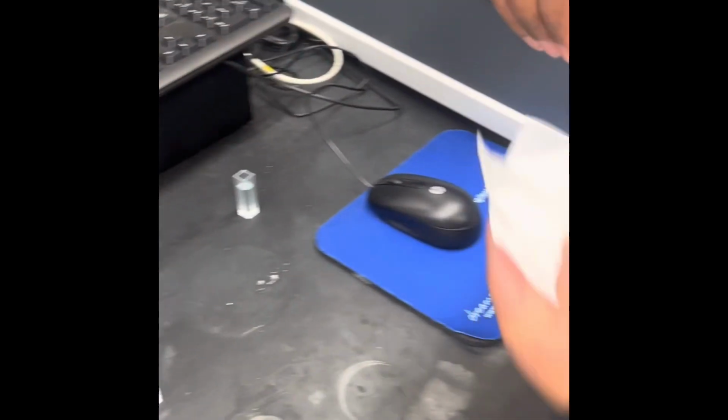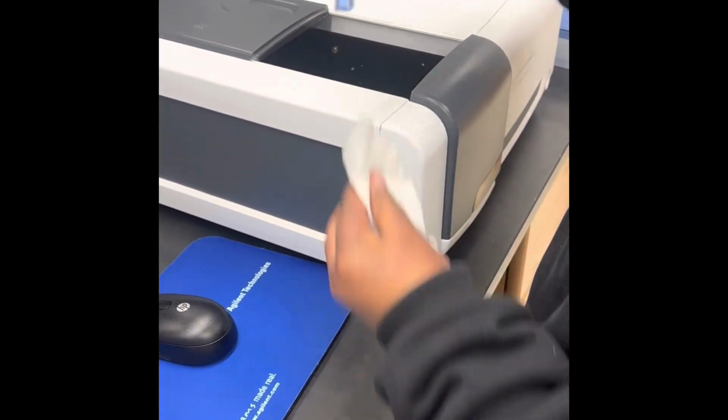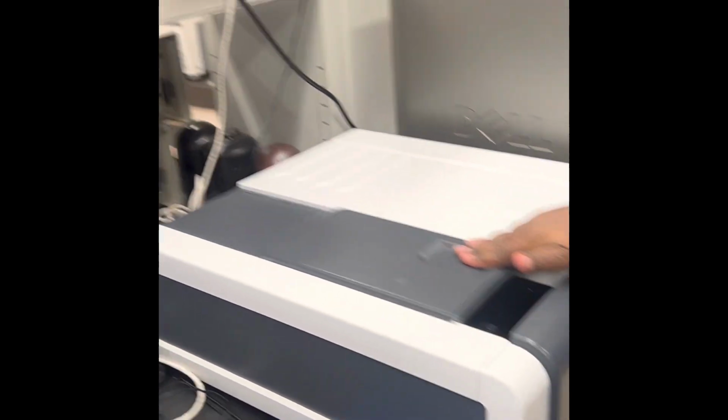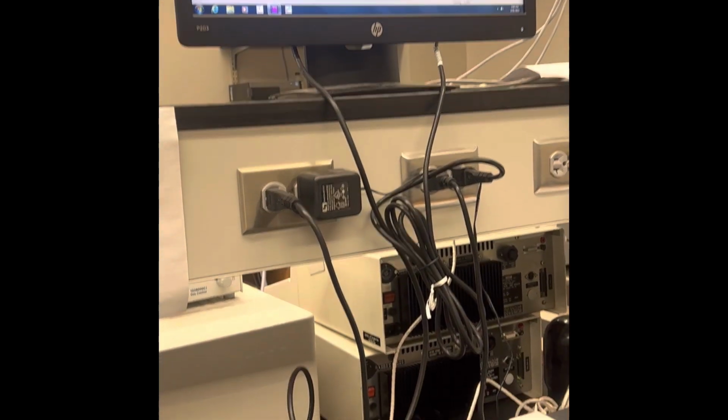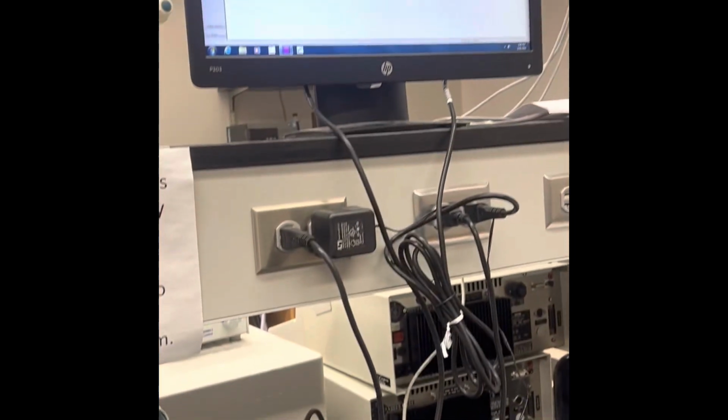As you can see, we're just continuing that same process of wiping the cuvette and loading them to get the reads. And we basically just do each dilution from there until all the dilutions are complete.